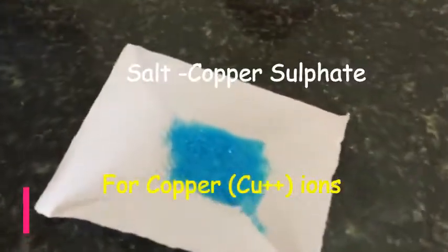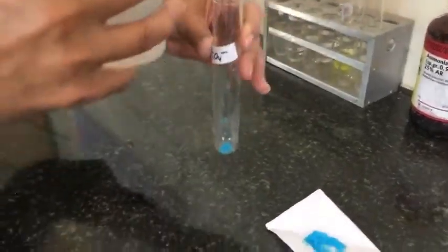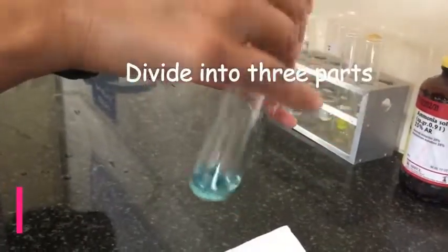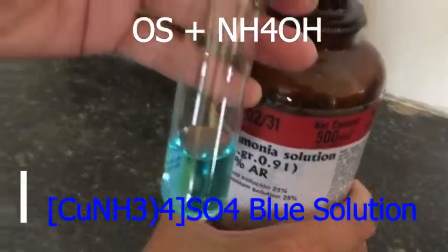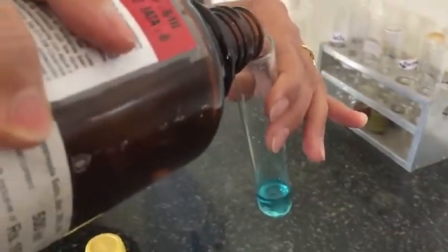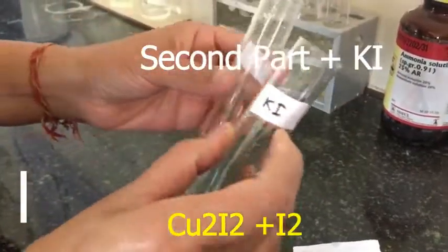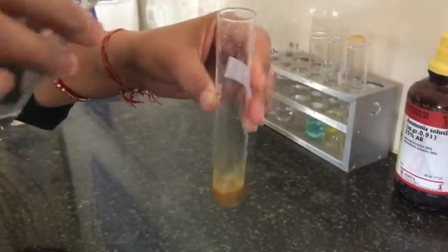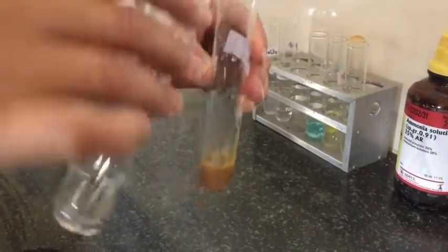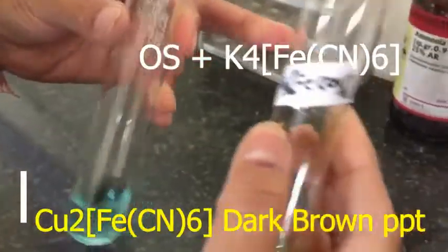Now we are going for the confirmatory test of copper. I prepare the original solution of copper and divide it into three parts. To the first part, I am adding ammonia solution, which forms the tetraamine-copper sulfate complex, which is dark blue in color. To the second part, adding potassium iodide gives a white precipitate of cuprous iodide and a brown color of iodine. When it settles down, you can see the white precipitate and brown color solution.